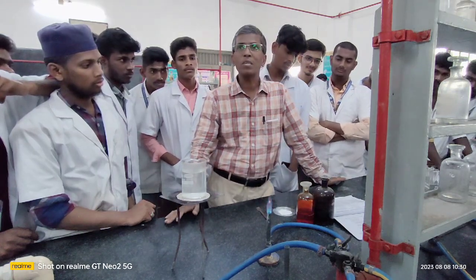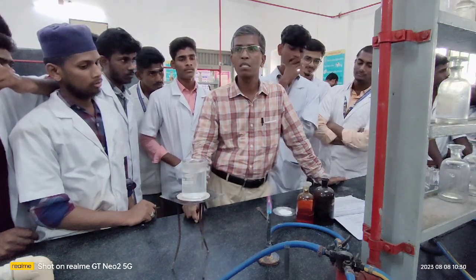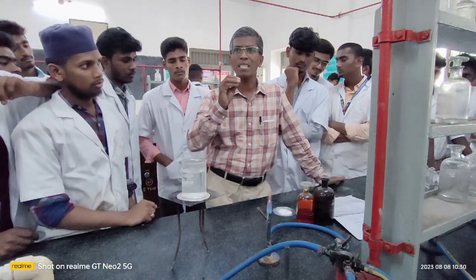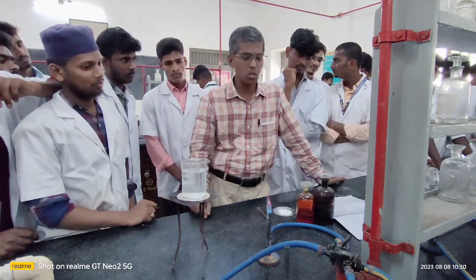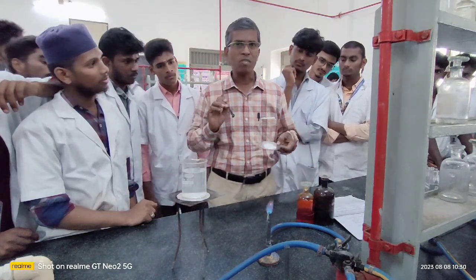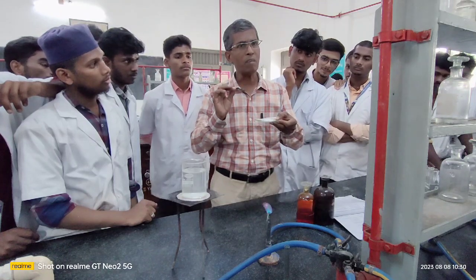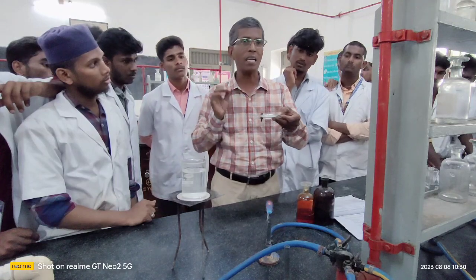Now I am going to demonstrate important steps in your organic compound analysis, where usually students are struggling, where usually the students are incomplete, I can say. As a result, they usually fail in completing their analysis. Number one, the moment you receive your organic compound, I am going to show you how to confirm whether the given compound is aromatic or aliphatic.